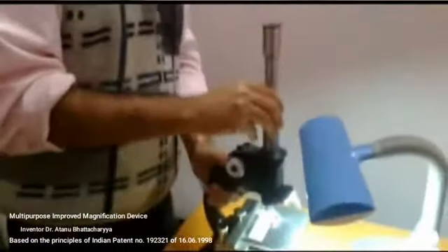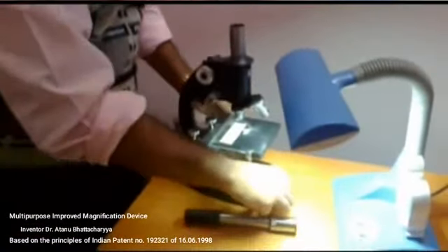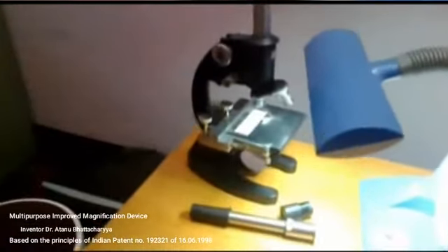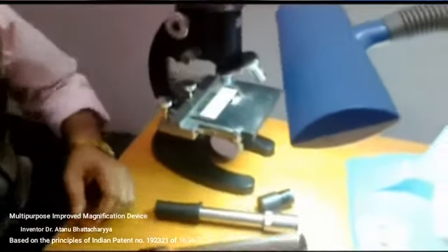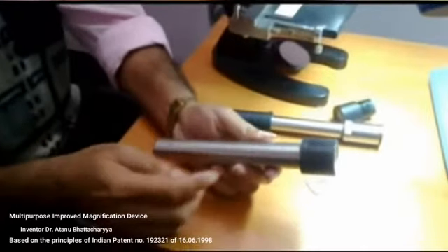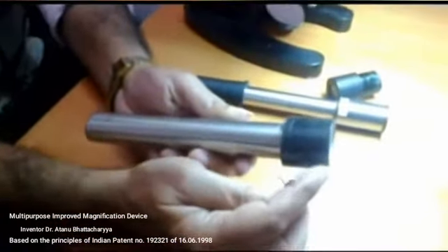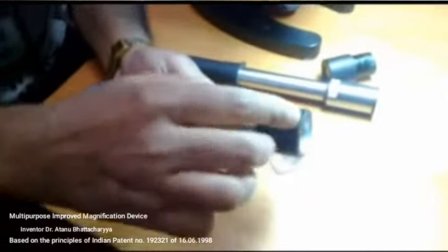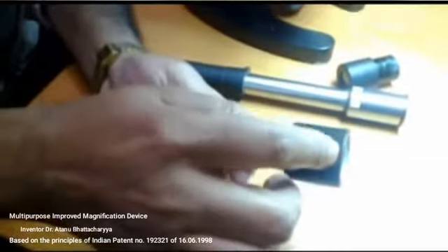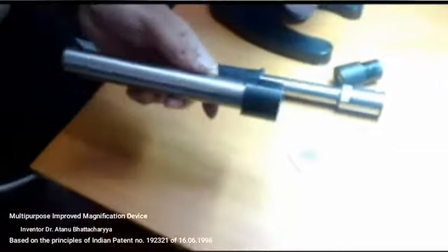This device can be used for other purposes also. It can be used as a field microscope cum telescope, and for that purpose a separate tube has to be used. This tube may be called the T3 tube. There is a lens on one end of this tube, and this lens has a focal length of approximately 5 cm. So it may be called another objective, and the tube is called T3.